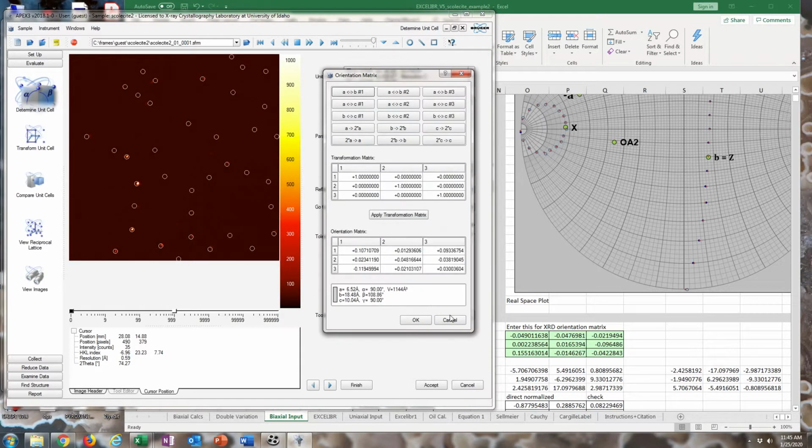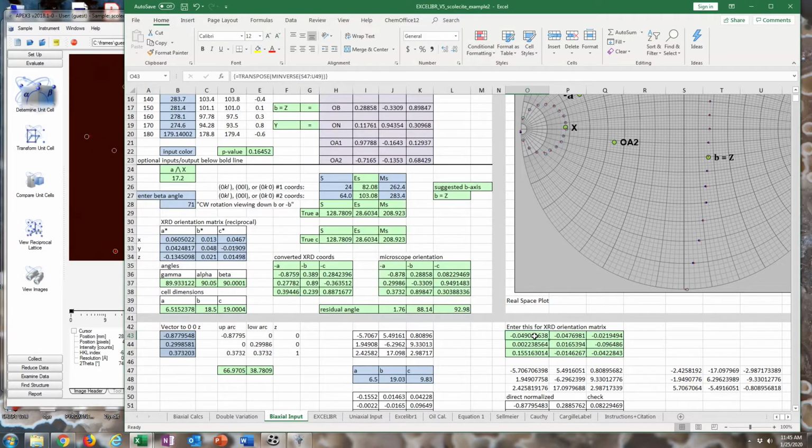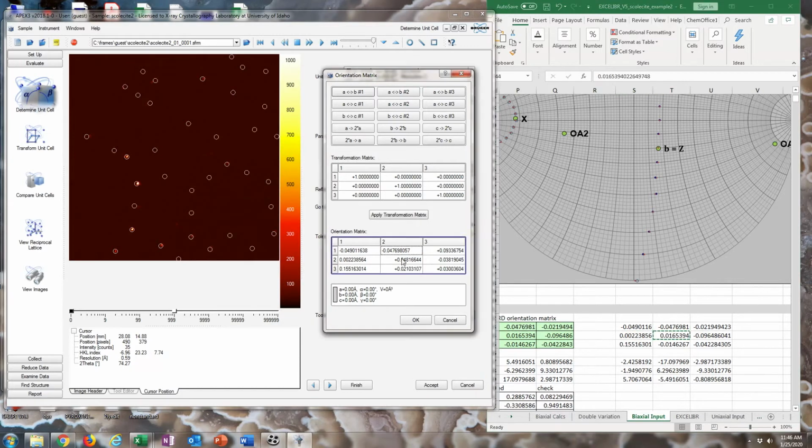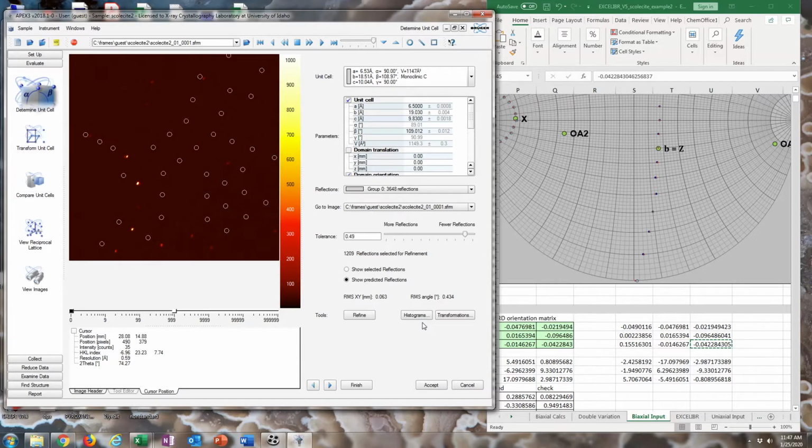And now I'm going to manually enter this orientation matrix, which I actually just need to paste the values. Yep. And since that uses an acute beta in this matrix, we're going to just change that. All you need to do is make A star and B star negative, or opposite sign, for each component of each vector. That has the right lattice parameters. Let's just hope. Okay, it looks bad right now, but we'll click Refine and see if it finds those spots. And it does, which is just great. So finally, we have the correct starting point at least.